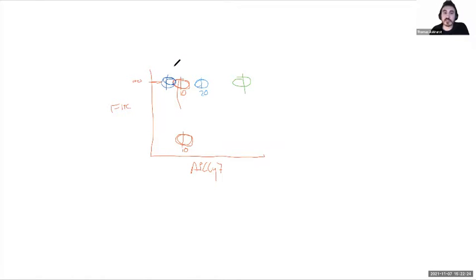For it to be over here could happen for two reasons. Well, two major reasons. There are a few reasons. One is that the material of these particles is not the same as these. So remember when I talked about the batches of the beads where the positives and negatives had different levels of autofluorescence. That's what could cause this. So let's say this was one batch of beads, it had a lower autofluorescence, and this was a different batch of beads and it had a higher level of autofluorescence. That could absolutely cause this situation. And so before we've even started with compensation, it already thinks that they're different. And so that could be causing a difference there.